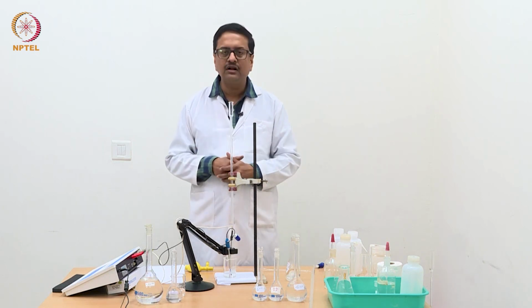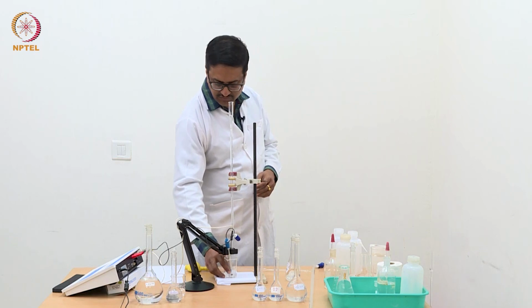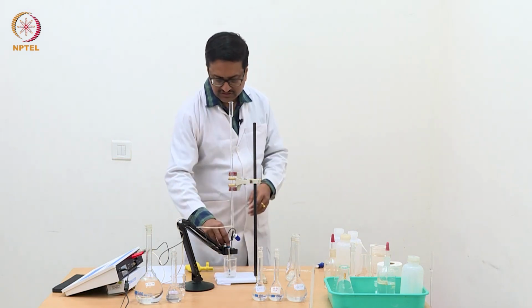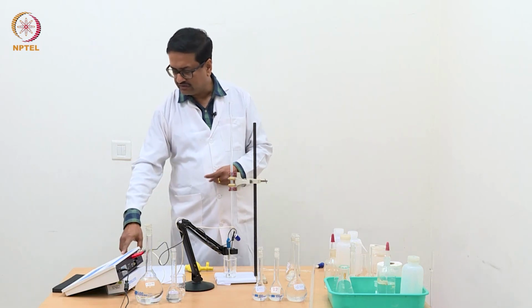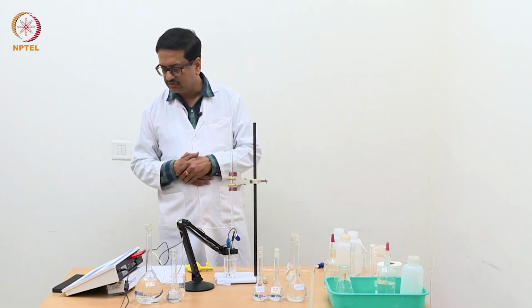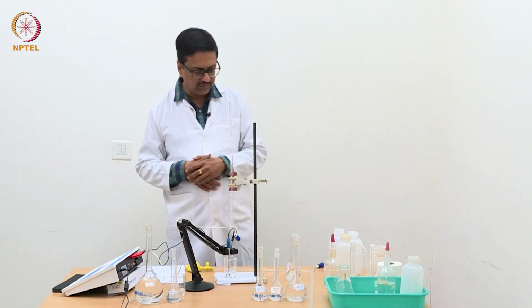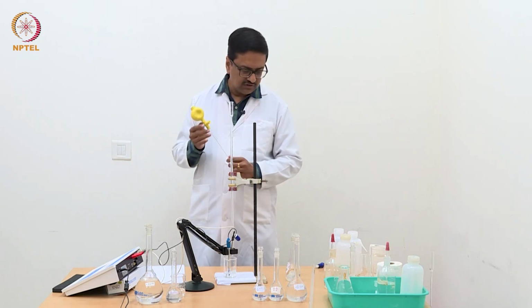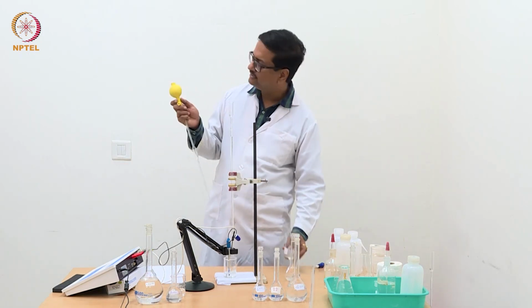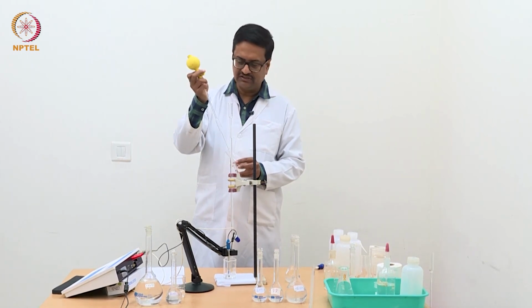So, at the moment, what we have taken in the beaker here is just some amount of distilled water, and you can see the conductance of that distilled water is shown here. It is about 8 microsiemens, 8.72 microsiemens. Now I am going to pipette out this triple mixture and add it to this water for the estimation.